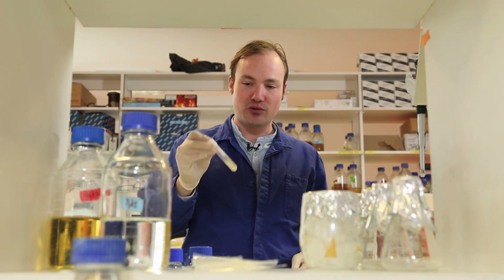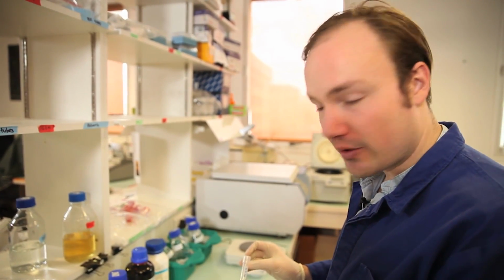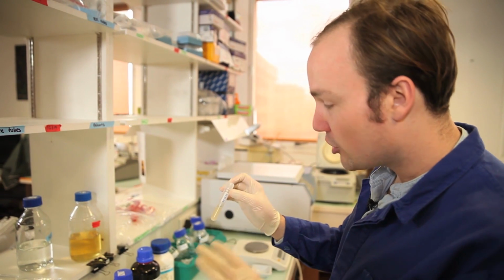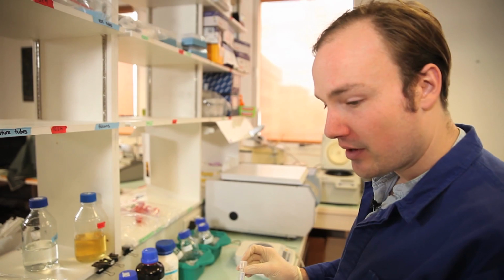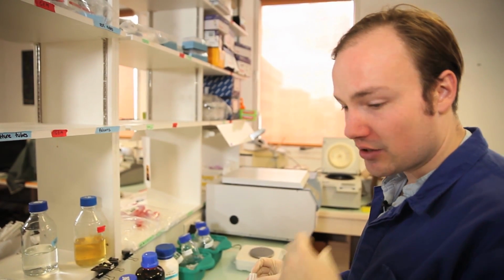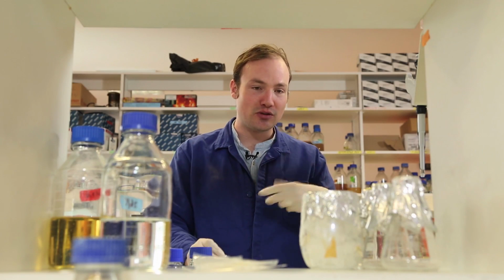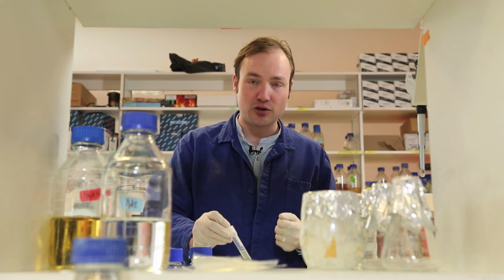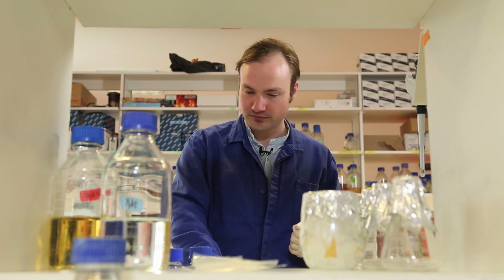Okay, so it's 8 to 12 hours later, and my culture of E. coli is nicely saturated. So the next morning, when you're ready to prepare your competent cells, what you do is you'll take these cells and we're going to dilute them by a factor of 200 into a fresh 50 ml culture. So we always want to make competent cells using freshly growing log phase E. coli because they're the healthiest and they'll be the most competent.